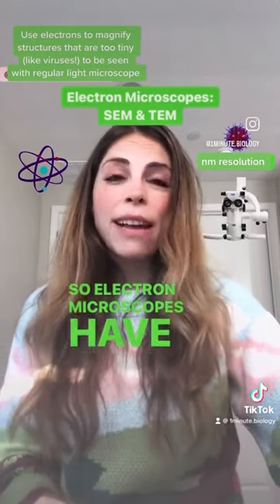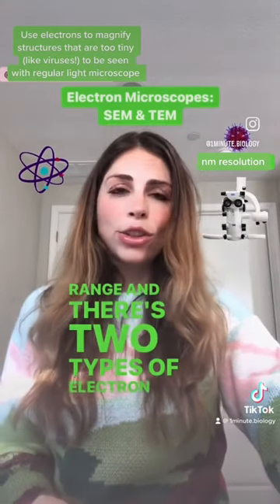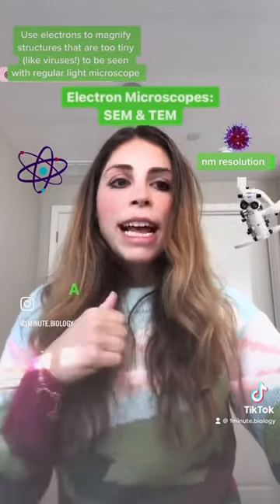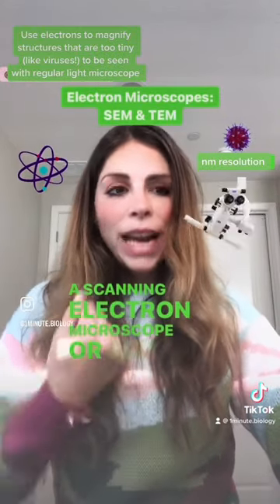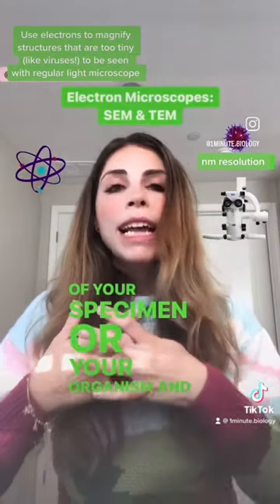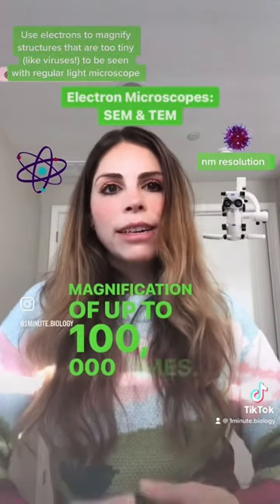Electron microscopes have resolution in the nanometer range, and there are two types of electron microscope: the scanning electron microscope and the transmission electron microscope. A scanning electron microscope, or SEM, gives you a 3D image of your specimen or organism, and it can give you a total magnification of up to a hundred thousand times.